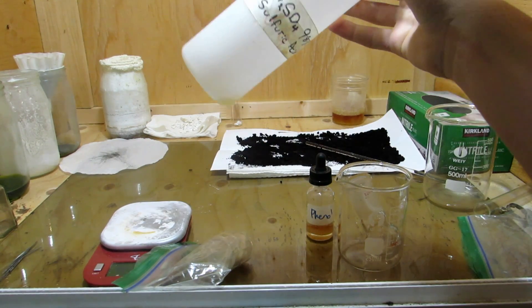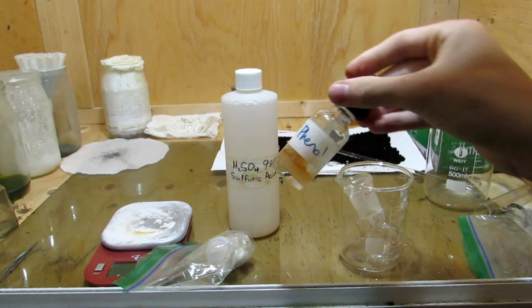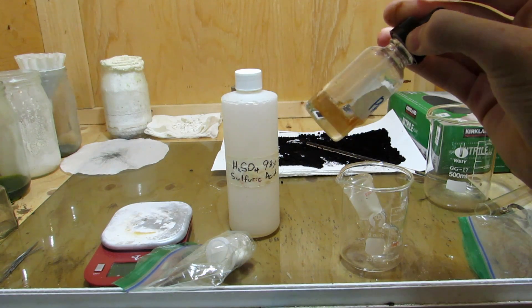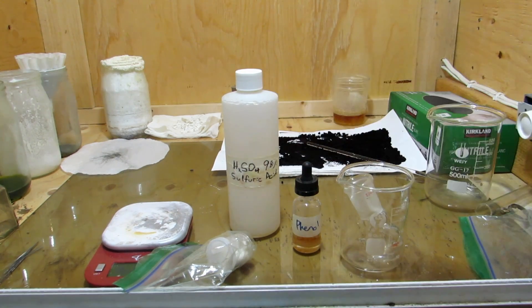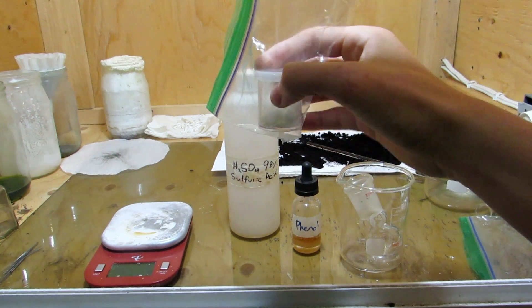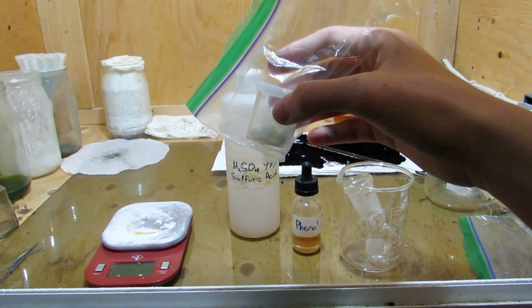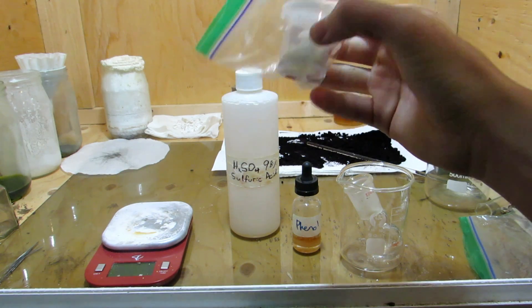Concentrated sulfuric acid — I only have a tiny bit left but we won't need much; it was made from drain cleaner. Our phenol here was originally derived from aspirin. It was pretty straightforward to make but we made it over a year ago so it's all oxidized by the air, but we're adding it in excess to accommodate for impurities and ensure all of our phthalic anhydride reacts. The phthalic anhydride was prepared starting from chemicals from wood ashes — we made potassium permanganate, then oxidized xylene, separated the ortho-isomer, and decomposed the ortho-phthalic acid to phthalic anhydride.